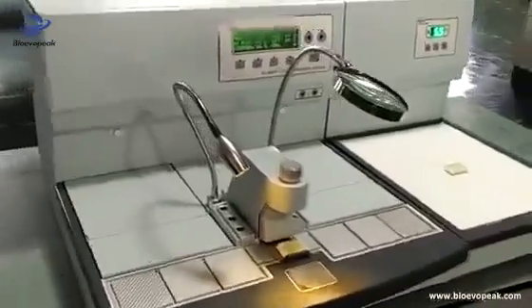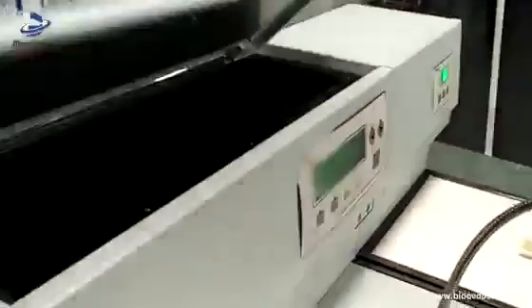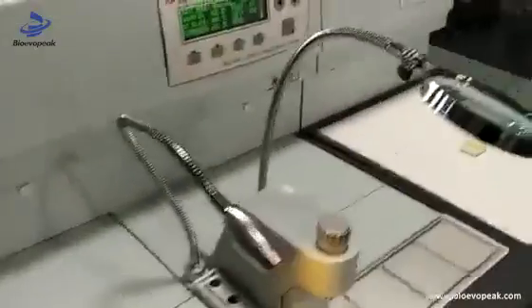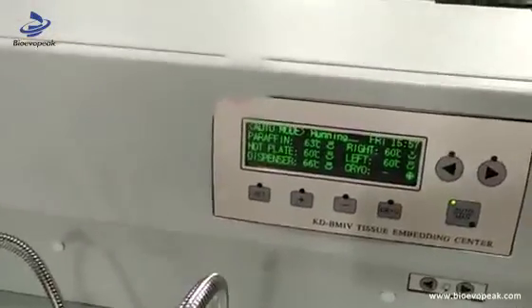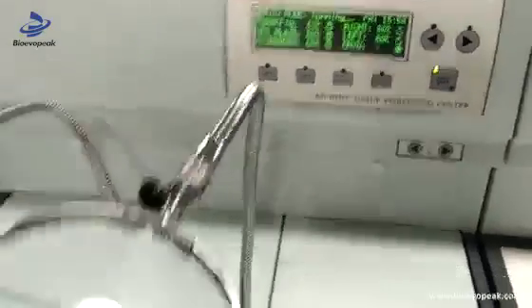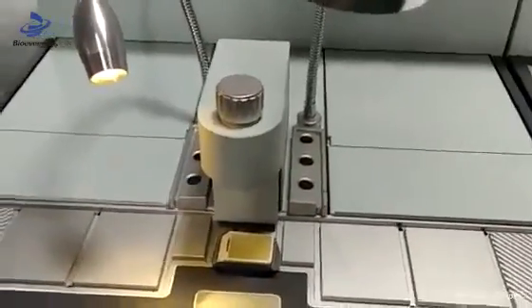Dear users, before you make embedding for the tissue block, first you need to put the paraffin block into the paraffin station, then close the door for the station. Secondly, set the temperature for different parts. Confirm by pressing this key to go to the running mode. When the paraffin block is melted, we can start to do tissue embedding.